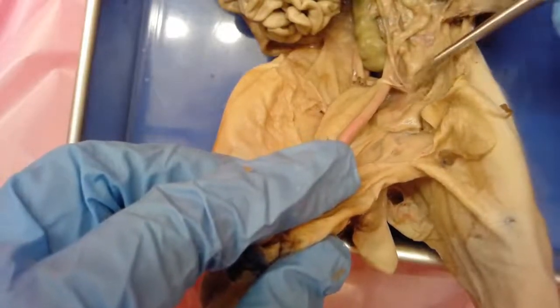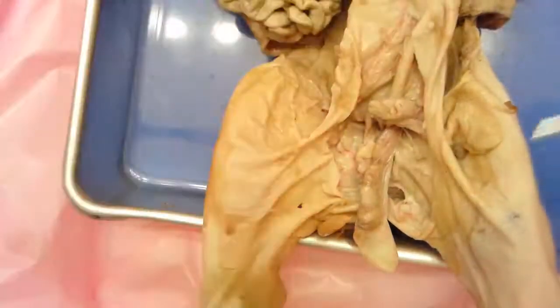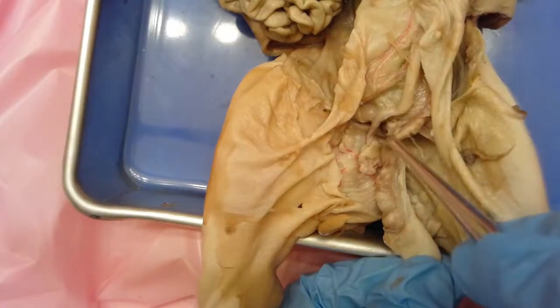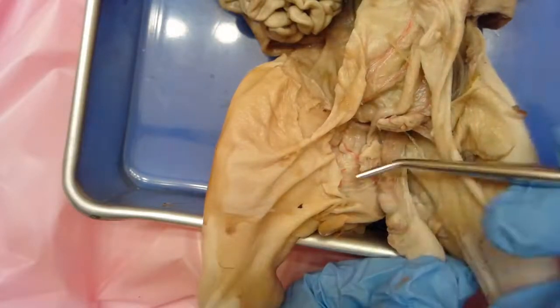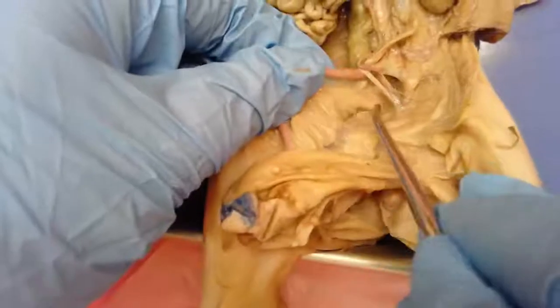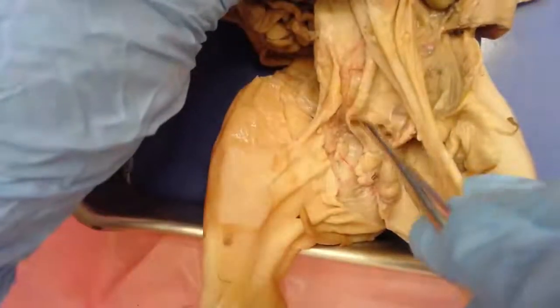The inguinal canal is the area where hernias can happen - it dilates that opening when that takes place. Now let's talk about why the testes are housed outside of the abdominal cavity. The temperature of the internal abdominal cavity is actually slightly higher than what's necessary for healthy sperm production, so the scrotum keeps the testes outside of that cavity. Sperm develops there, then enters the vas deferens, travels through those tubes into the urethra. You can see a tube right here running into the bladder.